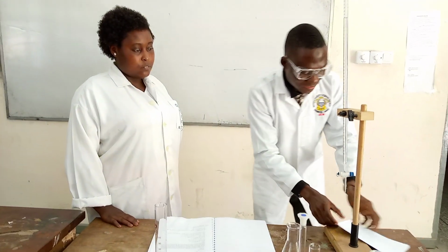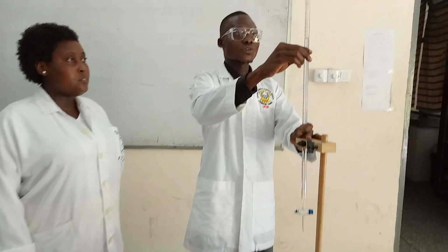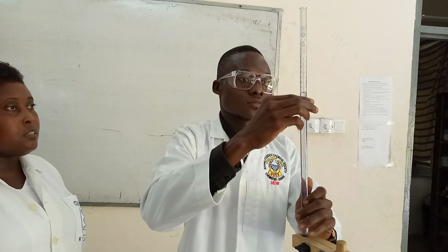So viewers, as my initial reading was 0.00, I will now read my final volume. My final reading will be 7.0.